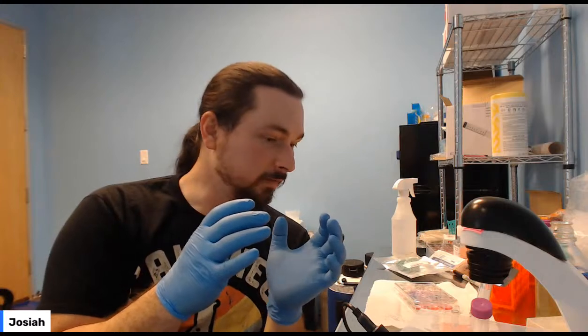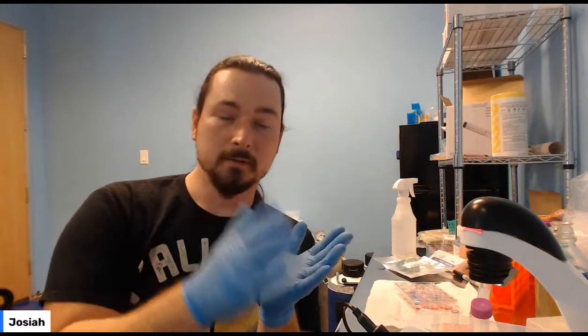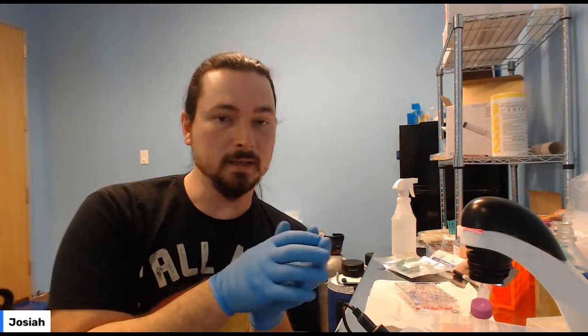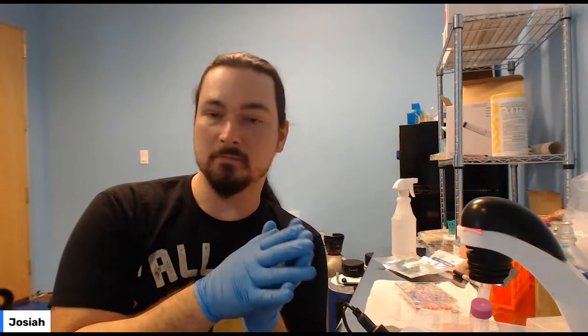So today you're gonna make a plate. Digest out one of your flasks. Make sure you have a backup. Take that, put it in your 12-well plate. Stick it in the incubator. Give it a day or two to grow. Keep checking it. Make sure that you have about 70% confluence. It's okay to go a little over that. I wouldn't go under that though.